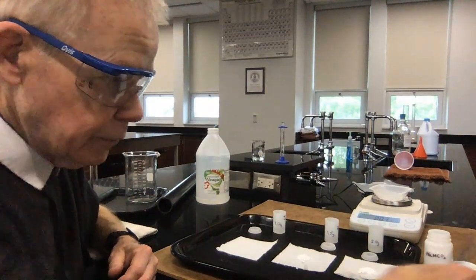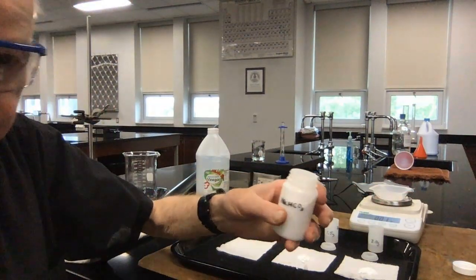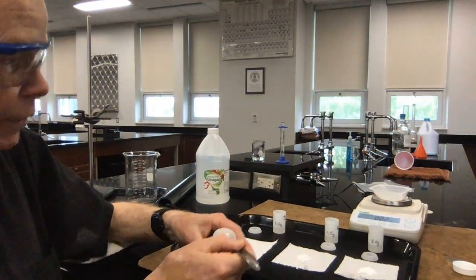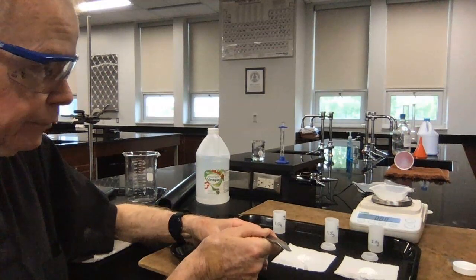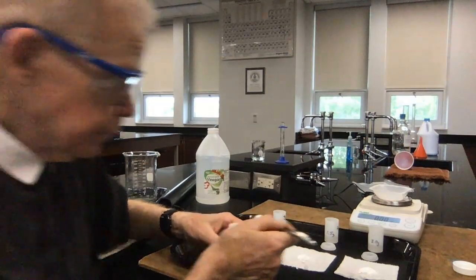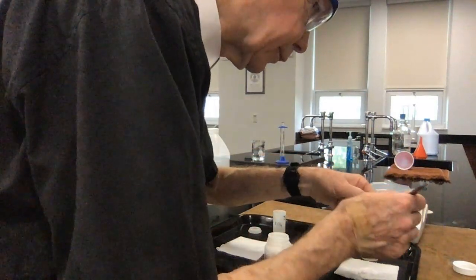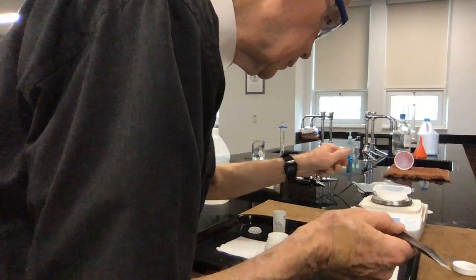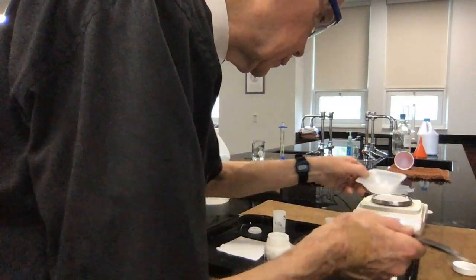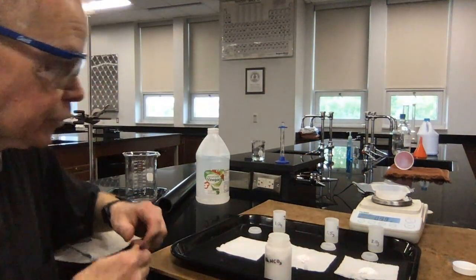Now the next thing is to mass out my baking soda, my sodium bicarbonate. Here's my vial, and in this first one I want to put 1 gram. So I have my massing pan on the balance. Let me tare the balance to read 0. There it is. We'll dump some in. If there's too much, we'll take some out. Just a slight amount more than 1. I'm going to take a little bit out. Just a tiny bit more. And we're reading 1.01 grams, so that's good for our experiment.